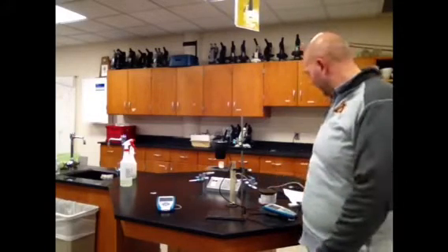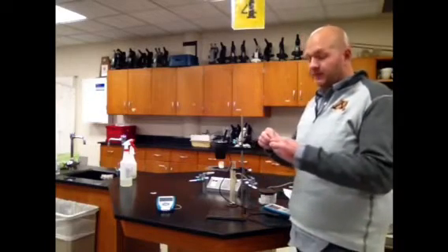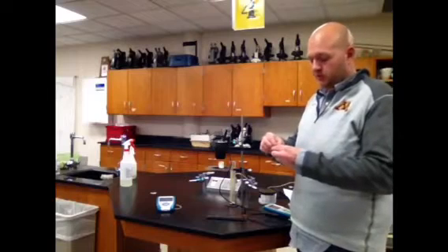While we're doing this, at the bottom of that data table it says qualitative observations while burning. This would be a good time to make a qualitative observation because we're burning it.